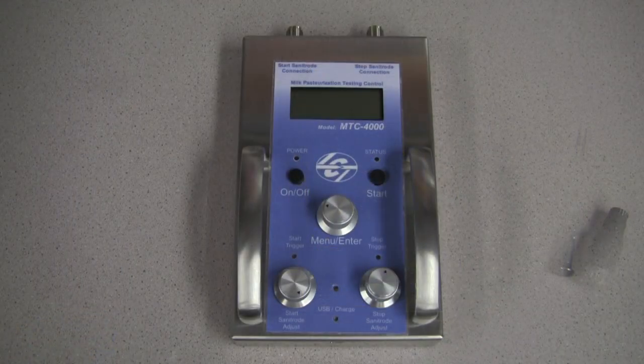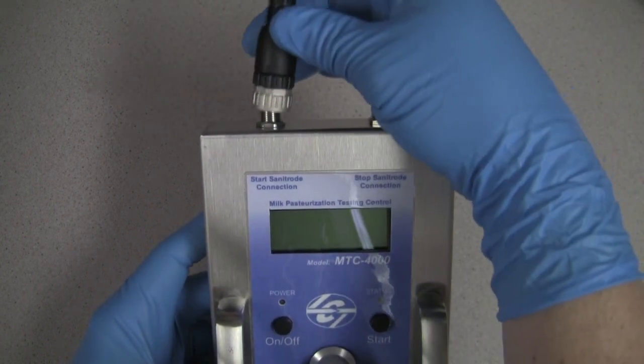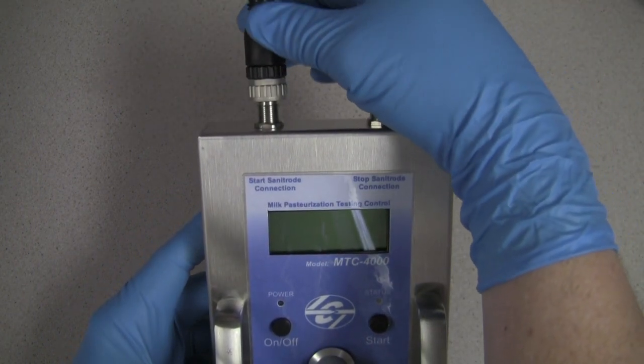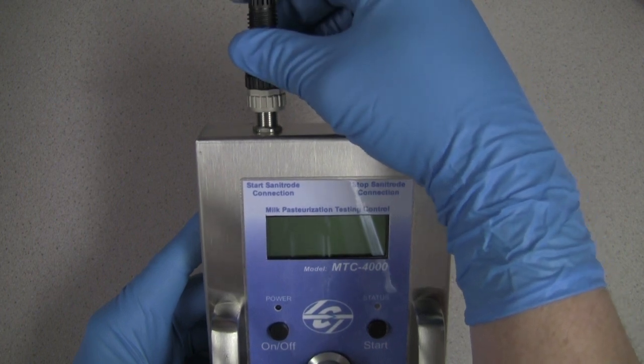When inserting the connector into the MTC4000, push down gently and rotate the connector either way until the jack's groove and the MTC4000's plastic guide lock into place.